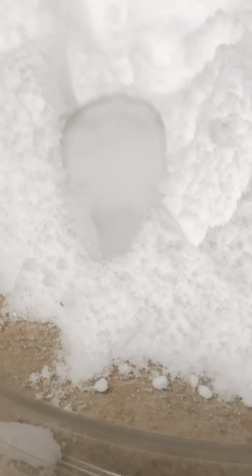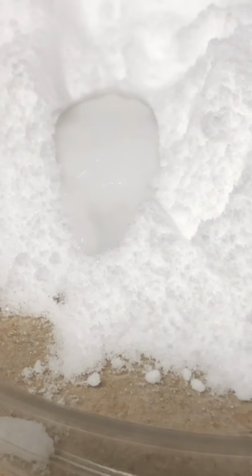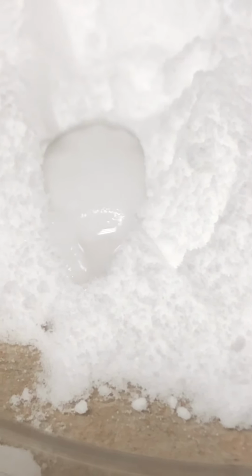Okay, we're going to zoom in. Alright, that one I didn't see any bubbles. It just kind of soaked the water in, so I would say there was no reaction. Alright, when I add the vinegar, I want you to make an observation about what happened.